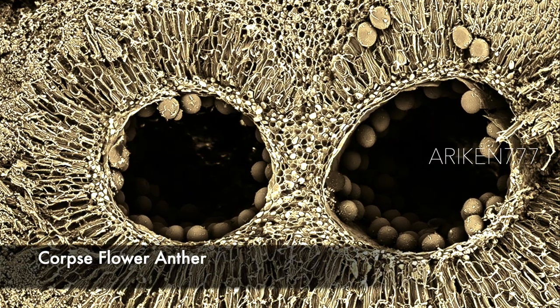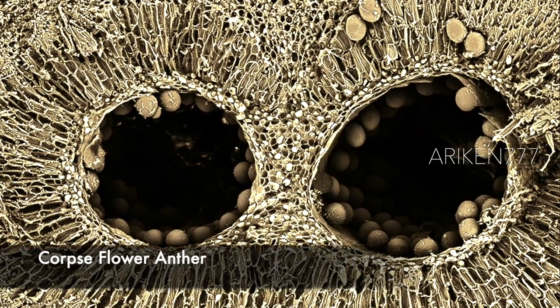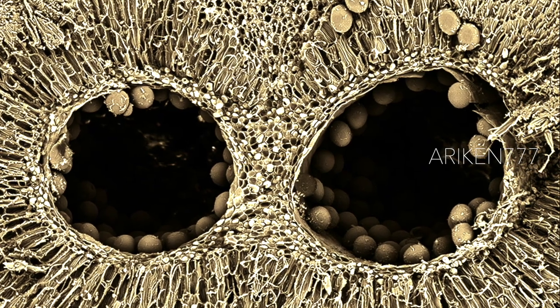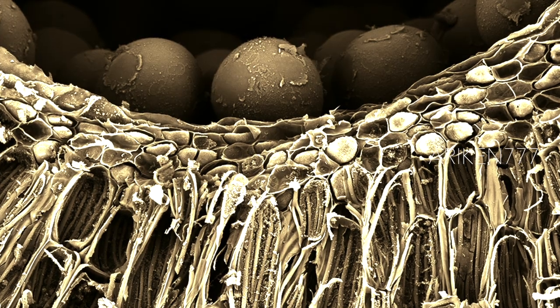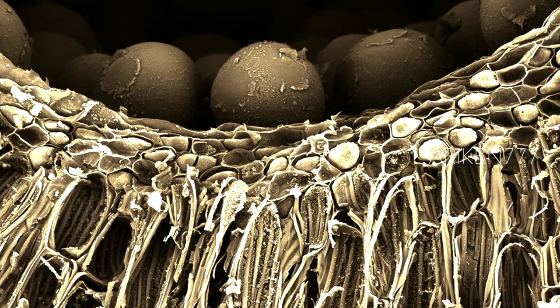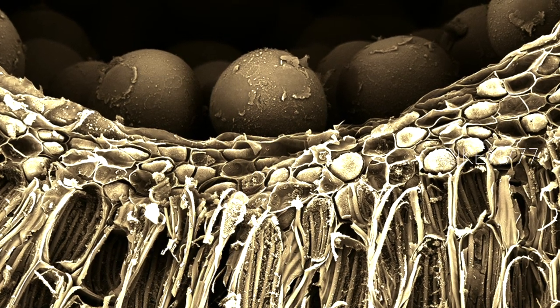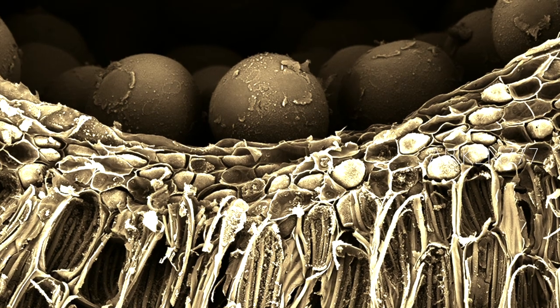Anther of titan arum, or corpse flower, showing the locule — the cavity where the pollen is located. The titan arum is a flowering plant that has the largest unbranched inflorescence in the world and smells of rotting flesh.